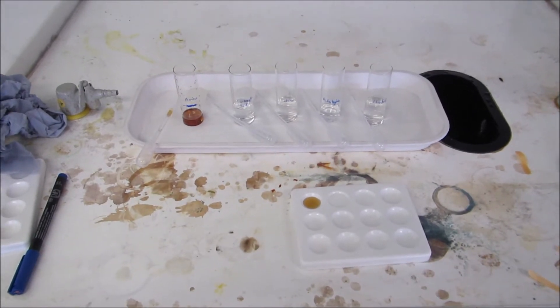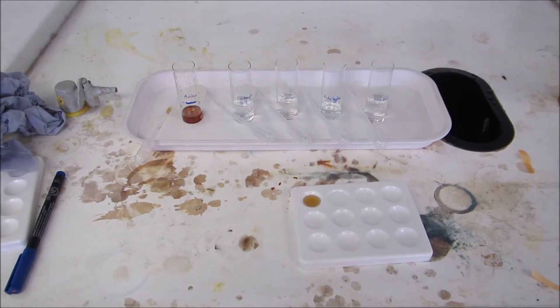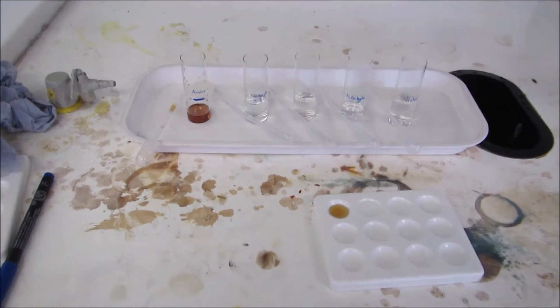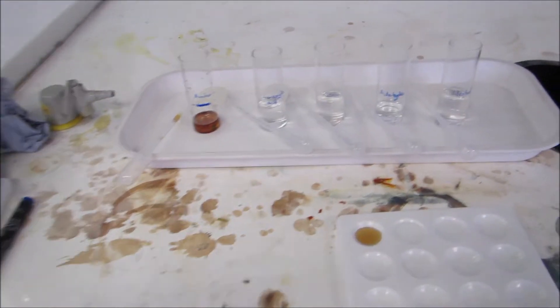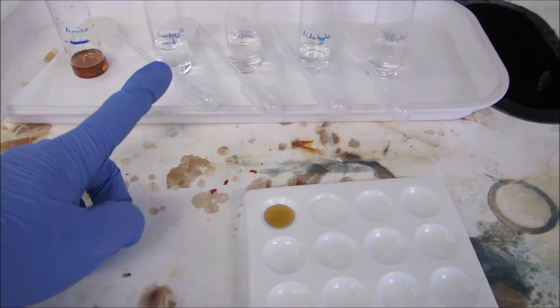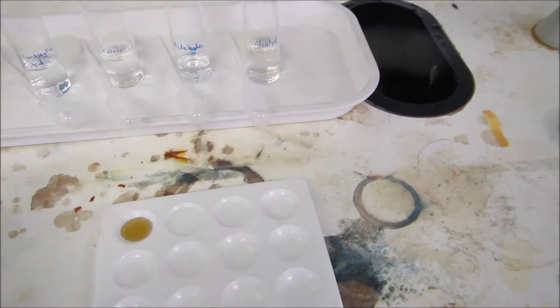When you're carrying out organic tests, there are a series of different test reactions to do. I'm going to show you how to identify amines, carboxylic acids, ketones, aldehydes, and alcohols.